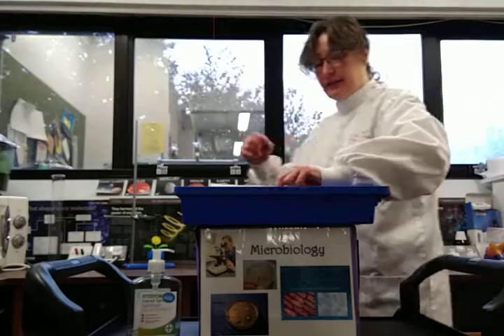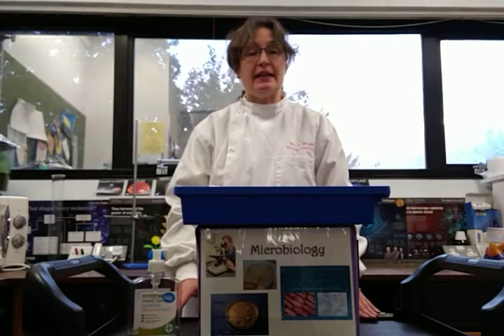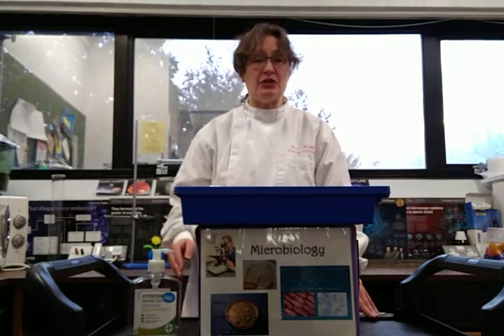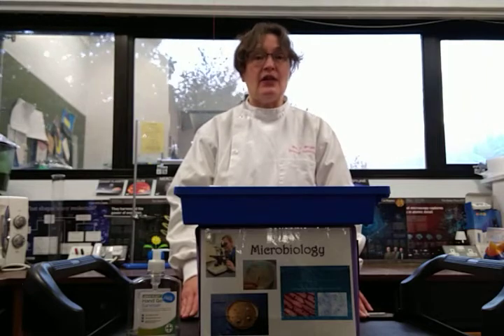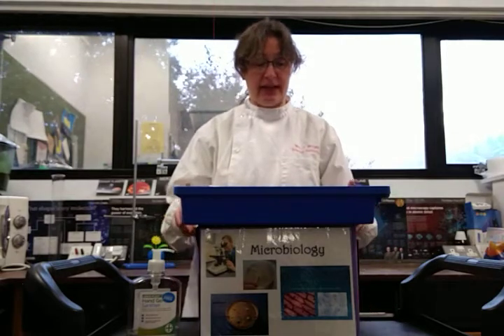Then we leave it to incubate for a couple of days in a warm place, but not in a temperature exceeding 25 degrees Celsius when we're in a school setting. That's because if temperatures were to get close to that which we find in the human body, we could end up growing bacteria that could be harmful to our health, so we want to avoid that.